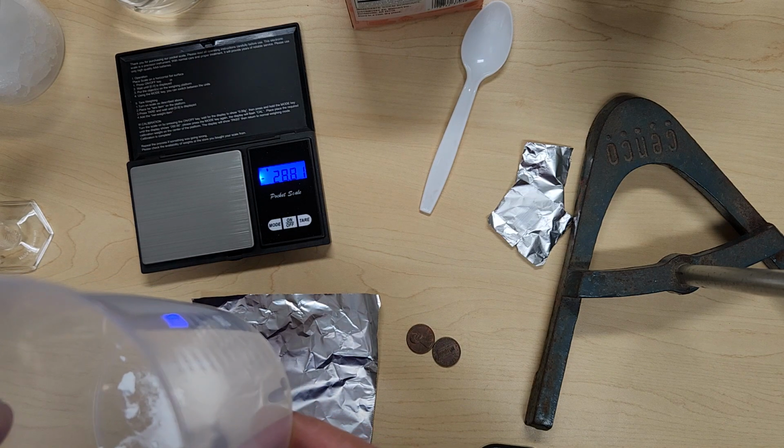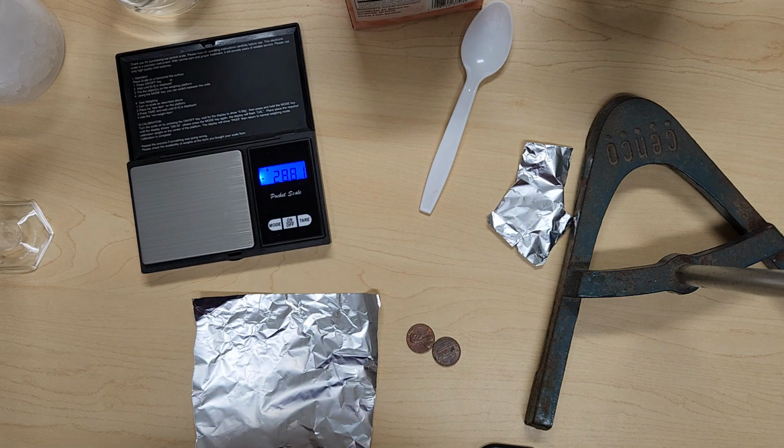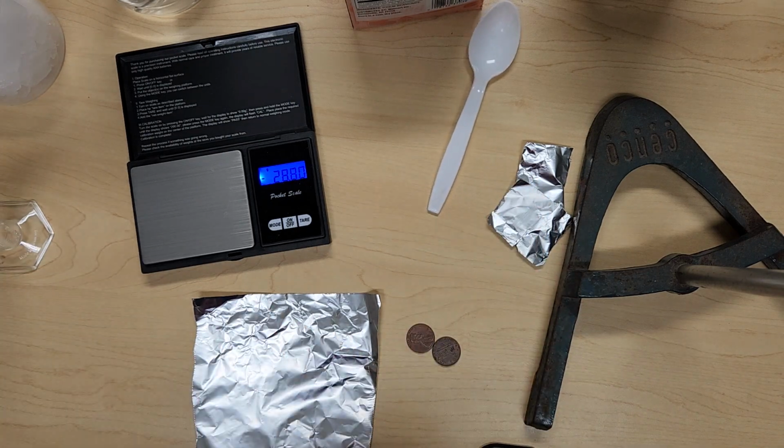So what do you see? What do you hear? Feel the container. What does that feel like? What changes have occurred? Then you're going to decide whether or not a physical or chemical change has happened, and take a picture of your experiment to include in your report form. Okay, all of that material can then go down the drain. Make sure you rinse your spoon, your beaker, your graduated cylinder so that there's no contamination for the next part of the lab.